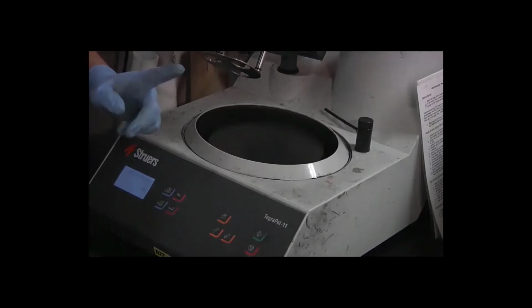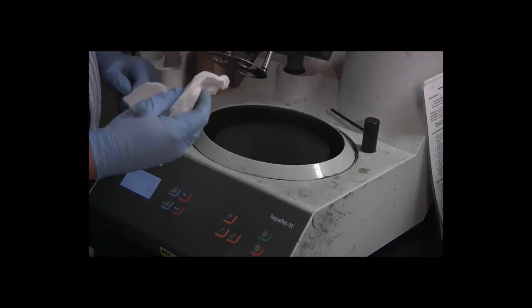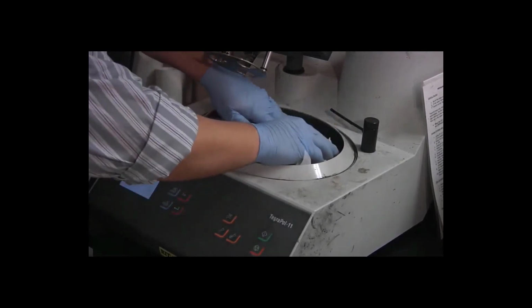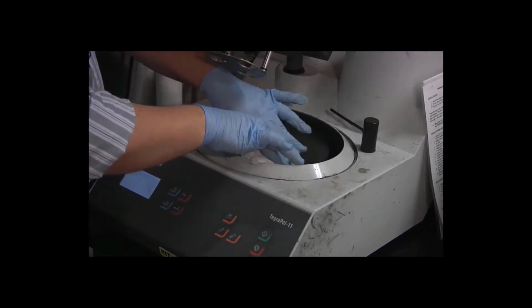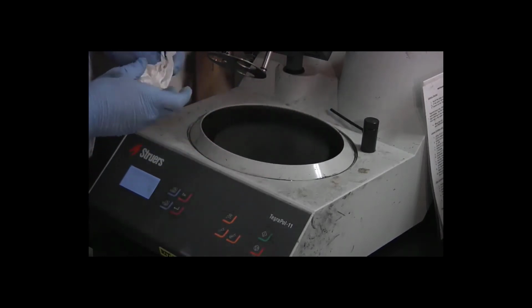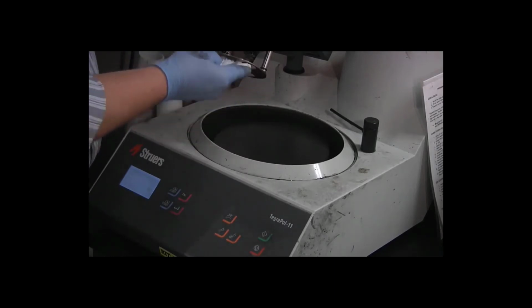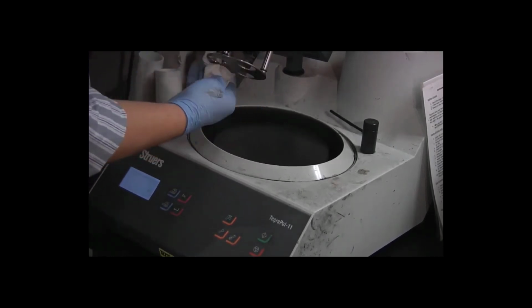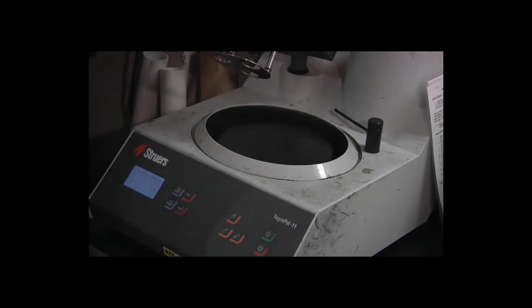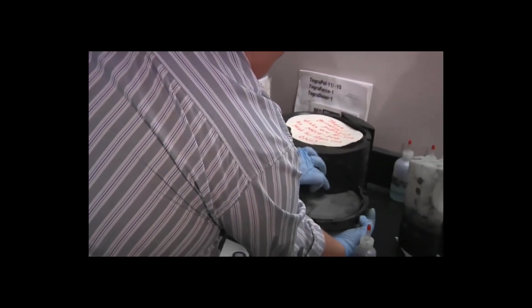So now that we've finished our grinding and we've verified that the specimens look pretty good, once more I'm going to take my damp paper towel. I'm going to wipe down the turntable to remove any residue, and in addition, I'm going to wipe the bottom of the mover plate just in case we got any residue on there. Now we can take out the first polishing disc, right? We're on our fourth stage of this process.